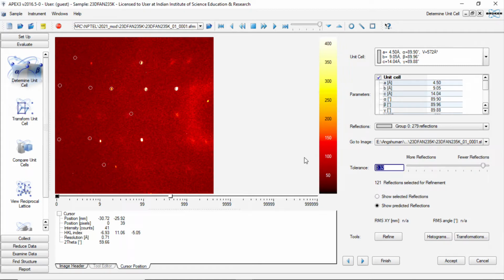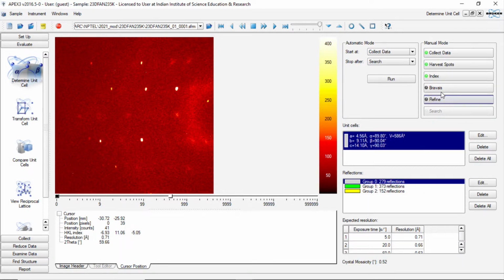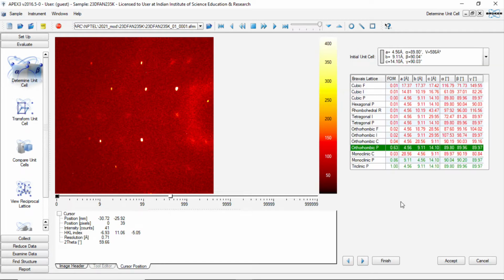So we set the tolerance to 1 and refine a few times. But we see that the standard deviations on the unit cell parameters are in the second to third decimal place. So then we accept this and go ahead and identify the lattice type. You see it is giving us 90.2 with monoclinic and orthorhombic as like this 89.8. At this moment I would prefer the monoclinic because it has a higher figure of merit, and 90.2 is a significant deviation from 90.